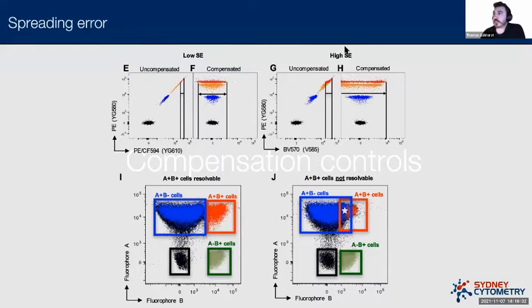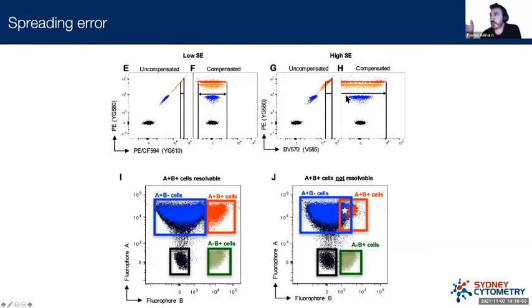A better example of demonstrating this is probably in this case. So if we're comparing PE with, in this case, BV570, we can see that the width of this uncompensated signal is actually much wider than in the example on the left. And when we compensate it, as we can see, the spread is also much wider. This is a problem. This is going to create some issues for us in the way that we analyze our data. But importantly, this is not something that we can correct. This isn't data that we've overcompensated or undercompensated. This is just physics. This is something we can't change. The only way we can change it is by going back and adjusting our panel. And we'll see a few examples of this shortly.